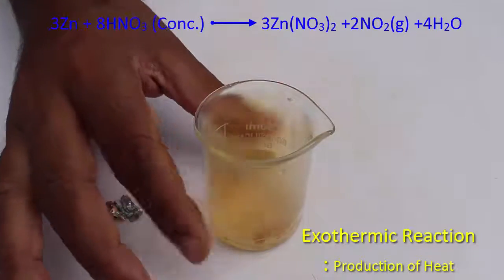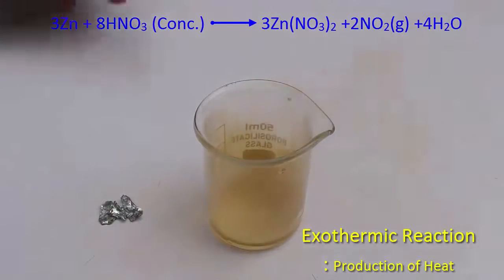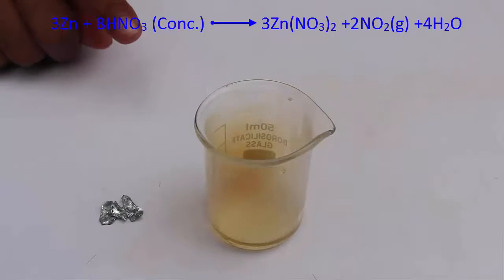So on touching the beaker you will find it very hot. The heat is produced so we call this an exothermic reaction.